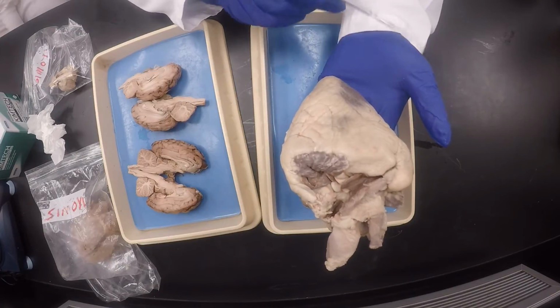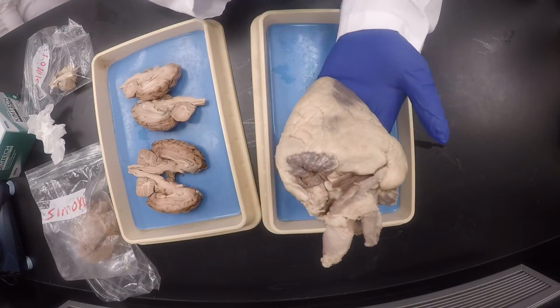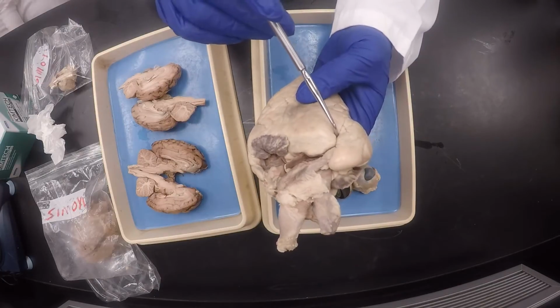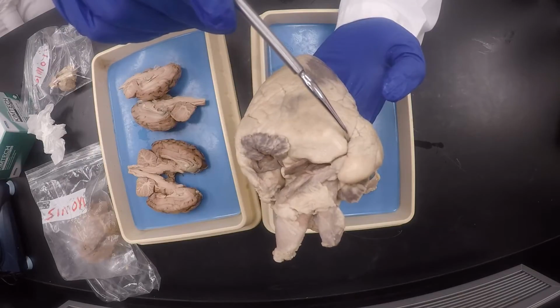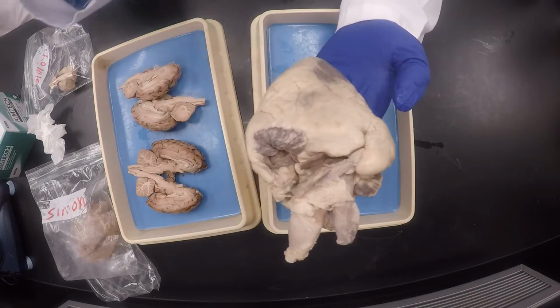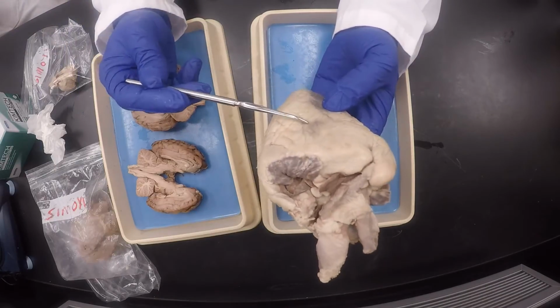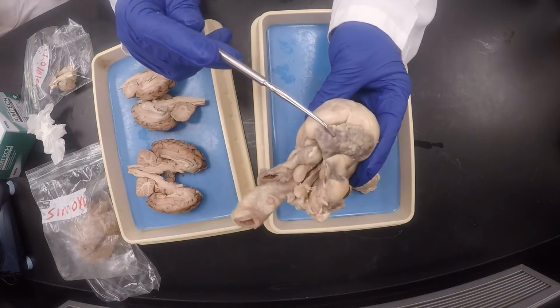Okay, I'll usually say what's that chamber of the heart, and you know to say ventricle, and so forth. If I put a pin here and I say what's that line, you say interventricular groove, or if you like interventricular sulcus. I'll take both. Okay, if this is the left ventricle, then this is the left auricle. Okay, and this is the right auricle.